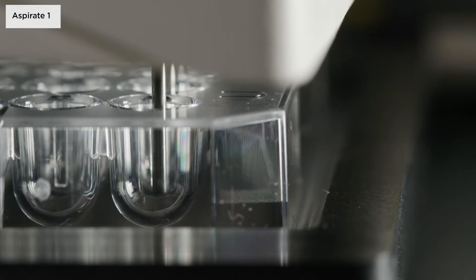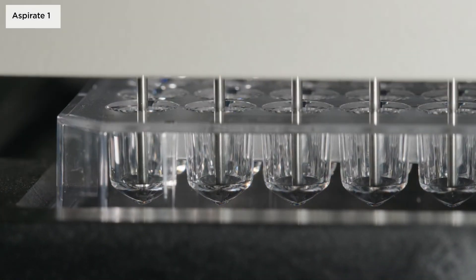Please note that for round or V-shaped well bottoms, the aspiration needles are placed in the centre of the wells.